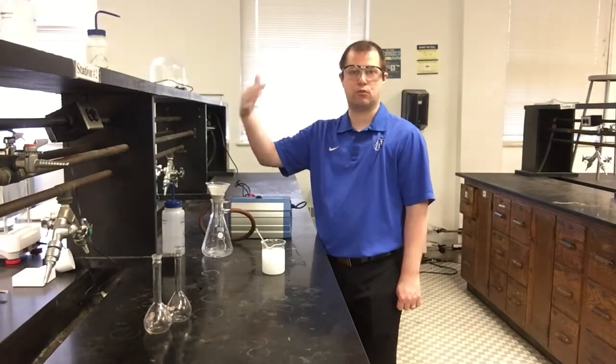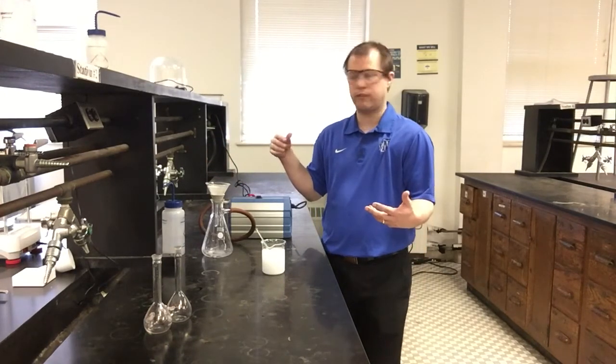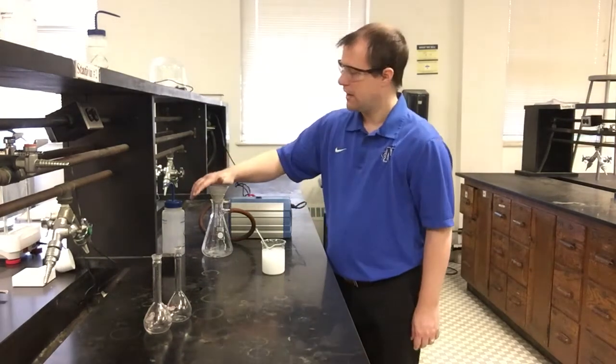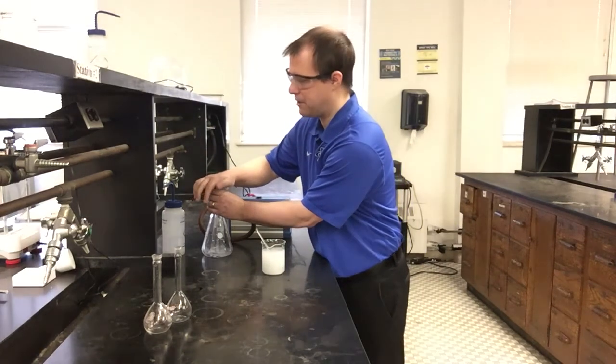But it also will help dry anything in that contents a little bit faster as well, which is something we are interested in for our final product to get a mass for. So I'm going to go ahead and turn on my vacuum for my pump. And if I put my hand over it, you can hear a little bit of the suction that's going to happen if I do it properly.